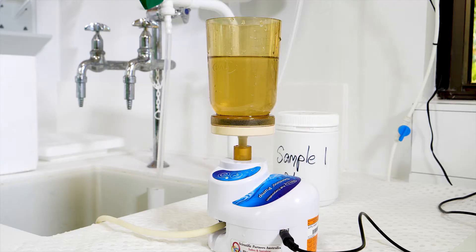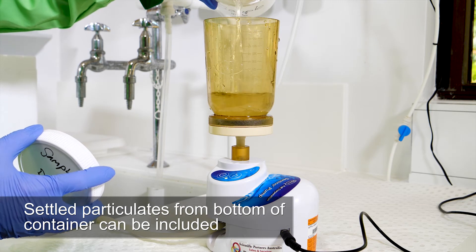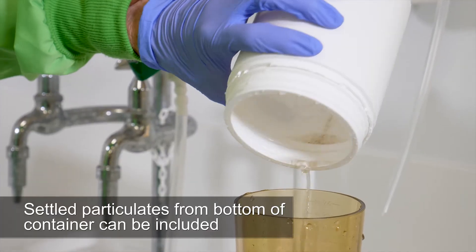After some time, the water level will drop. This will vary depending on the turbidity at your site. When it drops to a low level, then top the funnel back up with the remaining sample in the container.